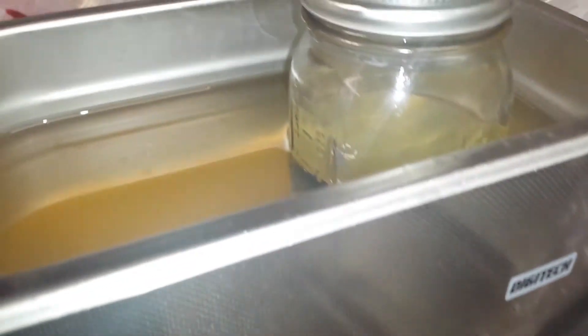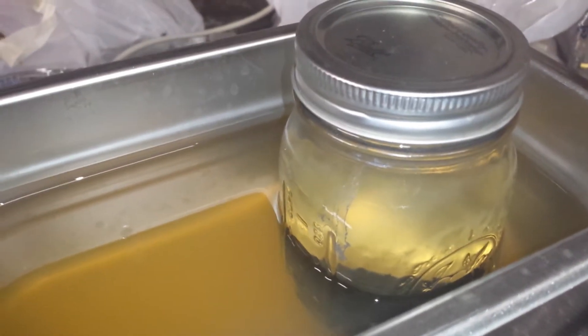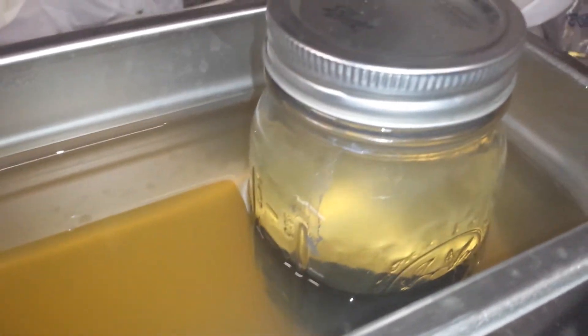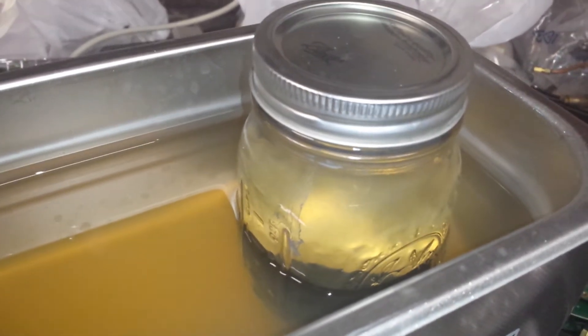Hello viewers, Mezcal here. I've been making graphene according to a method described by Robert Murray Smith — I'll put the link down below so you can have a look. Basically you mix up acetone, distilled water, and put some graphite in, then ultrasonicate it.